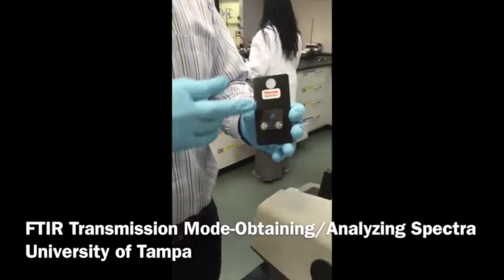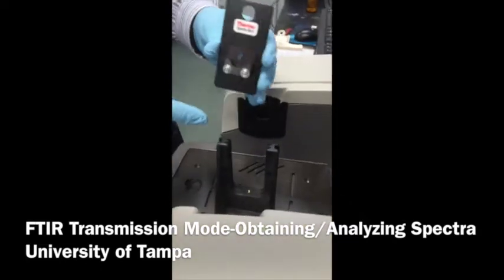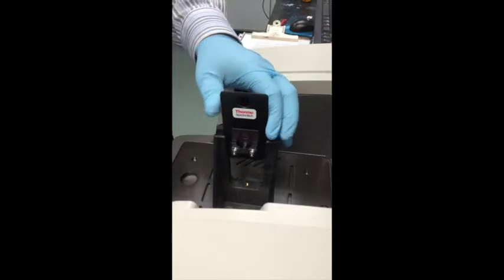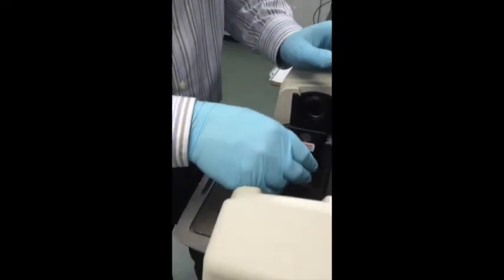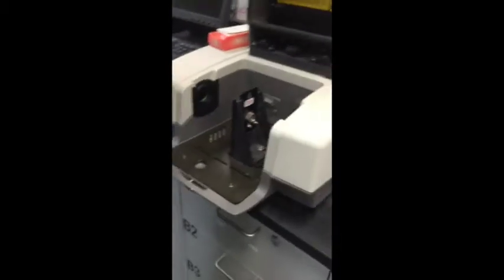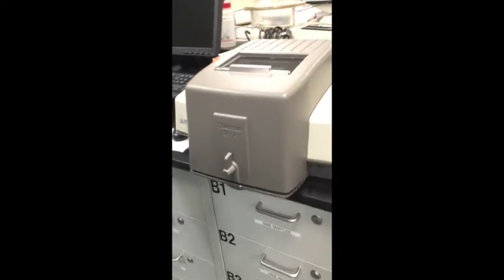So once you've constructed your pellet, you want to load it into the FTIR. You're going to use that attachment here and slide it into the device so that the word "thermo" is up, and you can read that word. Then the window that you made, you put in the beam between the light source and the detector, and then you close the top.